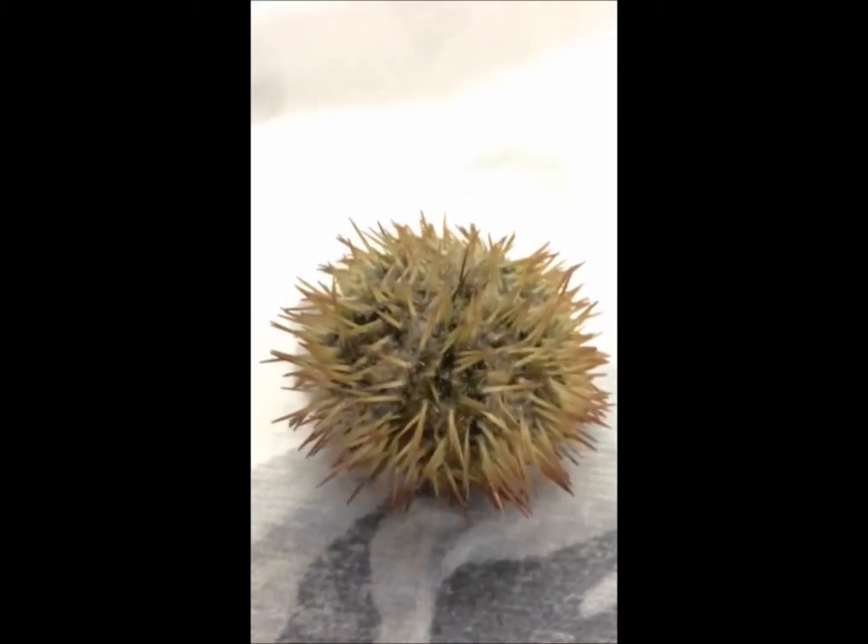I don't know, do you see them? Wouldn't it be gross if it just splurted it out at me? I need that — make sure we have water in case it needs water. Waiting for it. Alright, watch it open and close.